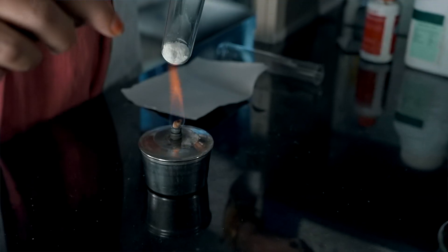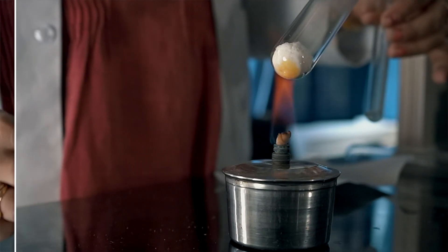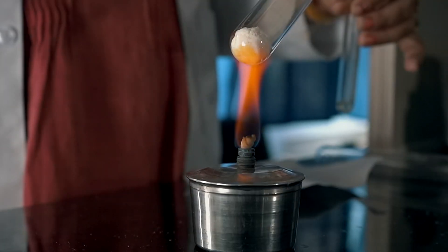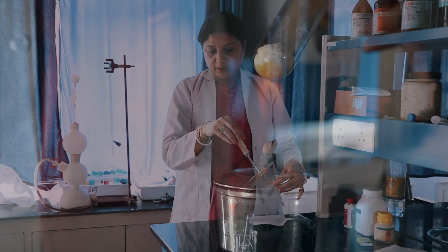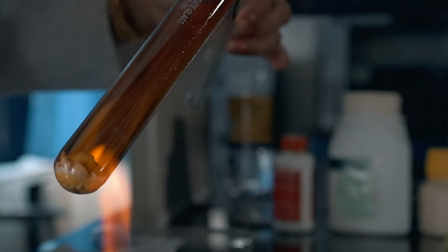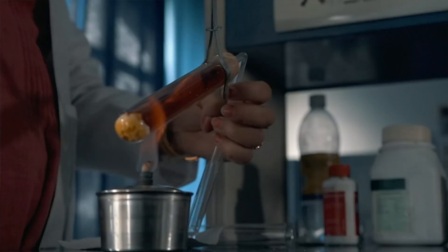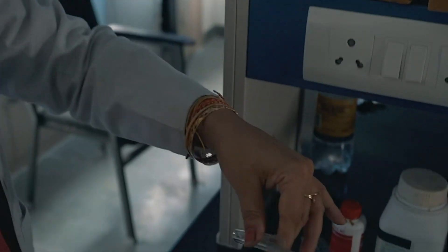Now I will heat this solid. When heated, it produces a decrepitation noise and the residue partially fuses with the glass. Now you see the residue lead oxide — it is reddish brown when hot; on cooling it becomes yellow.